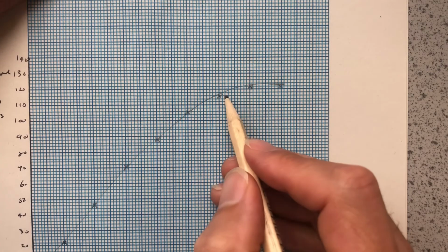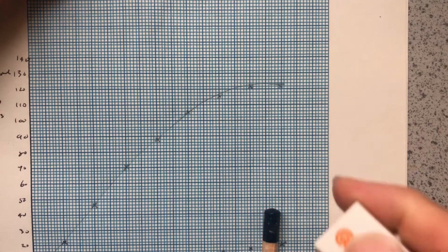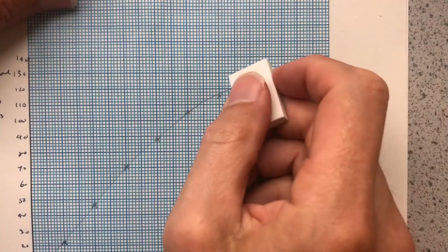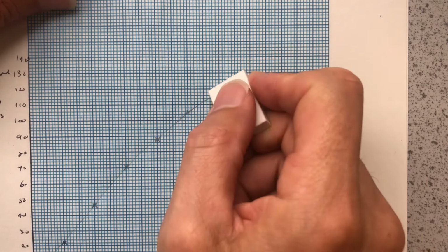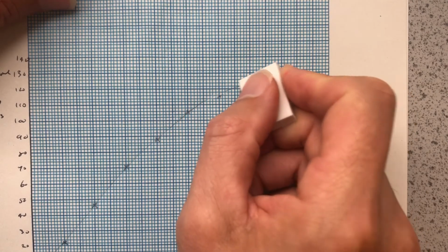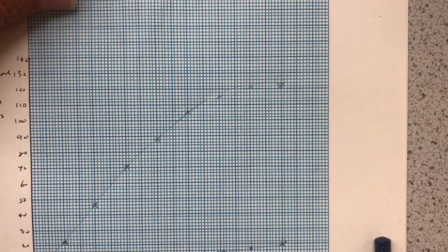I probably could have improved that. I might even get a rubber and improve that end of the curve, so I'm just going to rub this last bit out. If we look really close here, my line of best fit has gone above that point, that point, that point, so it's not ideal at the end. It's going all right until then. So I'm just going to rub the line of best fit out. And again, this is another reason we always do graphs in pencil.